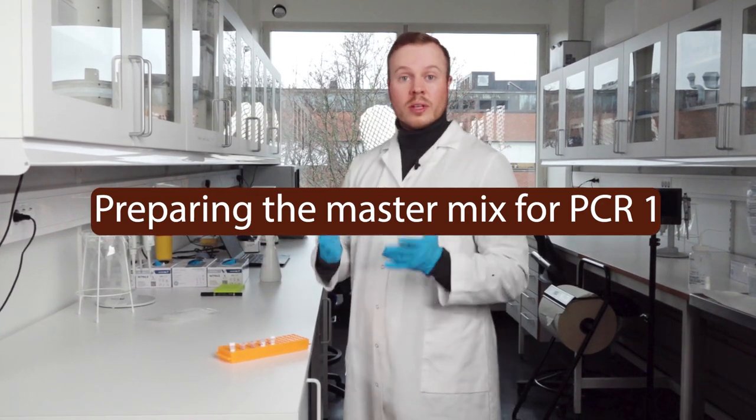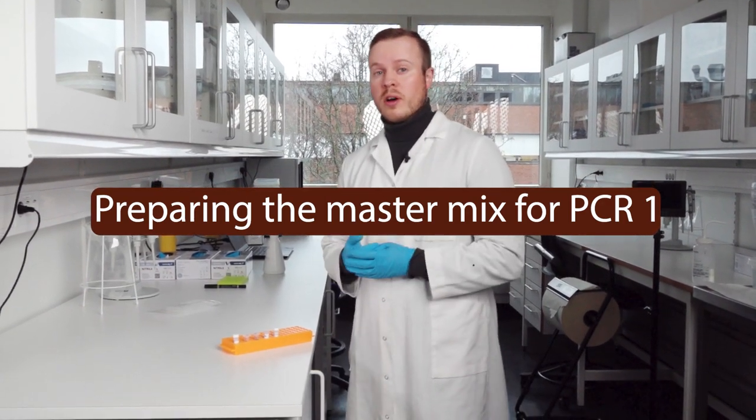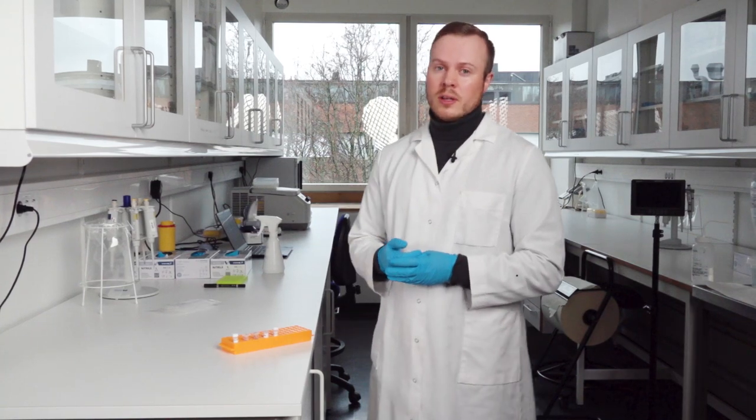So now we have turned on the UV cabinet, and while it runs for half an hour, it's a very good idea to start preparing for mixing the master mix.